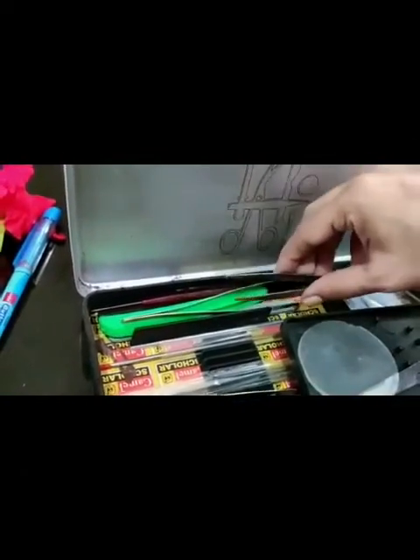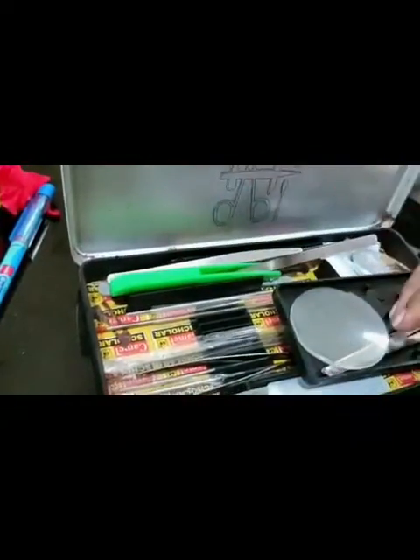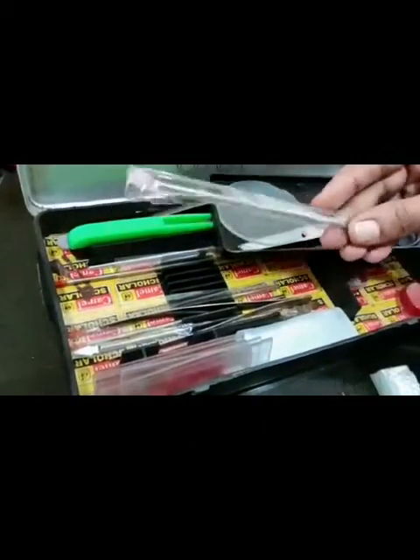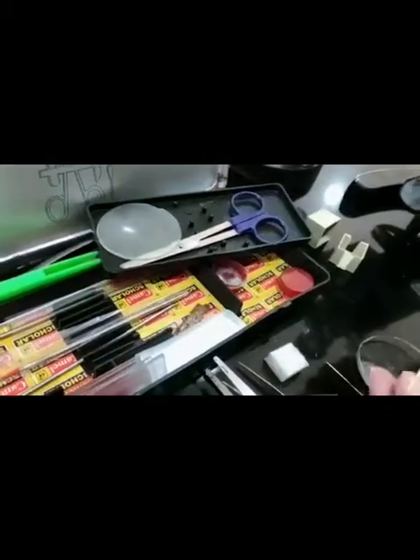Other instruments in the dissection box used in biology practical include: the razor blade, different slides also come with this set, this is called a scalpel — used for cutting — then two types of forceps: this is the pointed forcep and this is the blunted forcep. There is also another type of needle used for teasing.